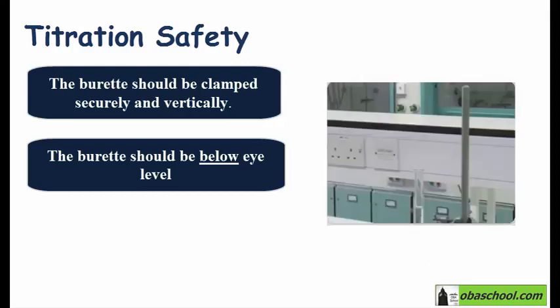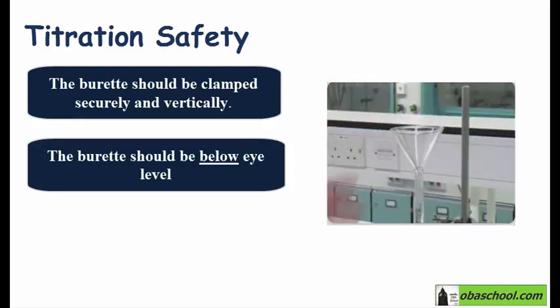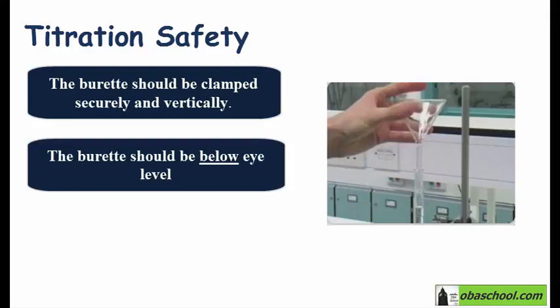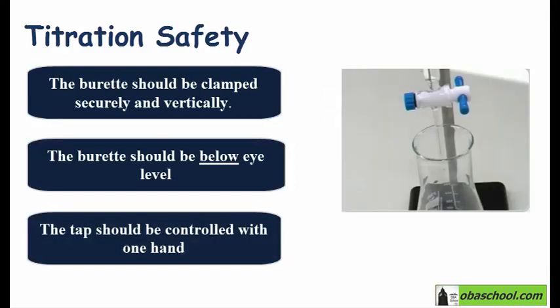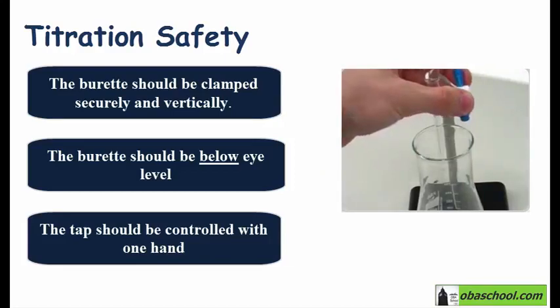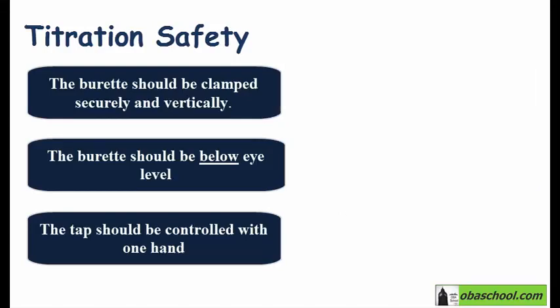Never fill a burette above eye level. You should always bring the top of the burette below eye level and fill using a funnel. Don't forget to remove the funnel at the end. The tap should be controlled with one hand while the other hand is used to mix the contents of the flask. Never force the tap. So these are the safety precautions that you should pay attention to while conducting a titration experiment.